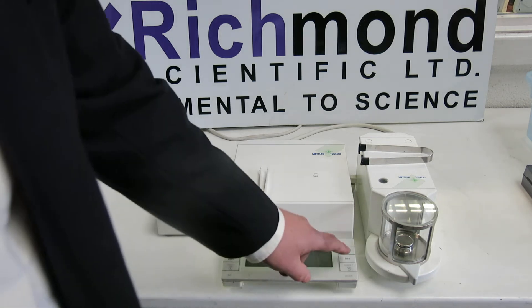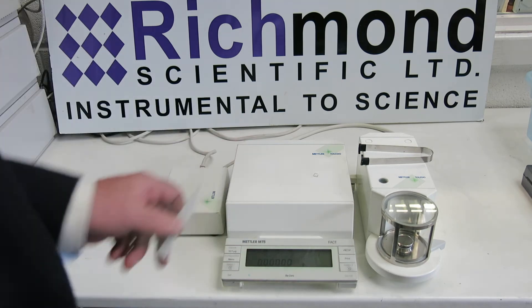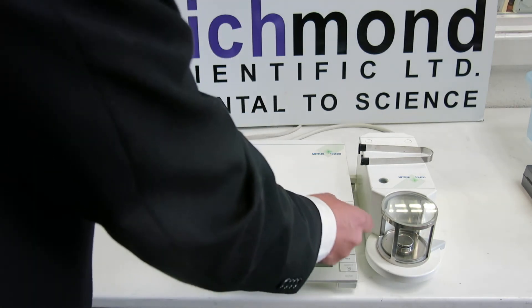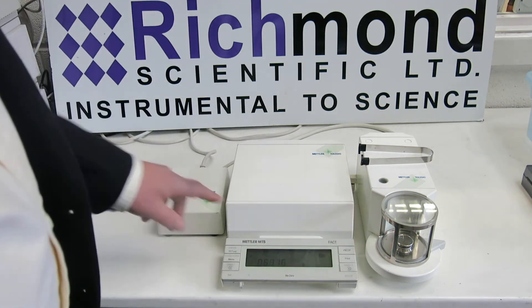What I'm now going to do is just demonstrate the opening capability, which is here. This is in fact a twisted staple. Let's put that on there and close it.